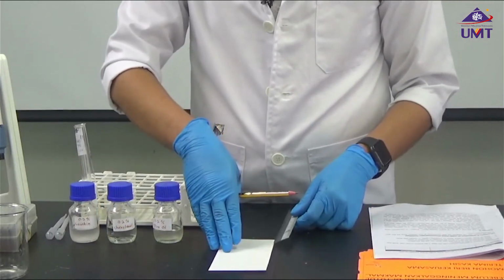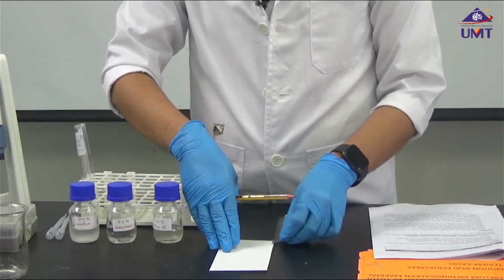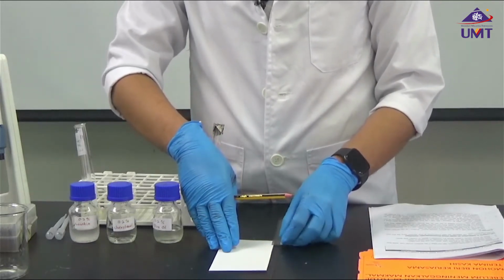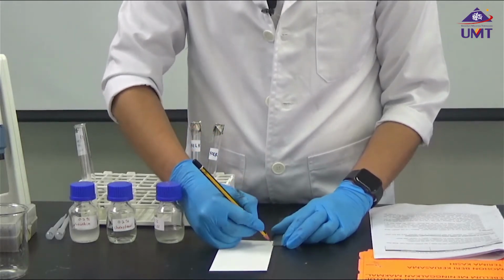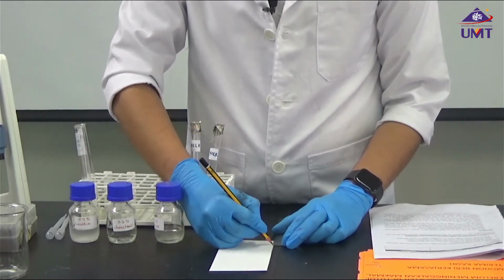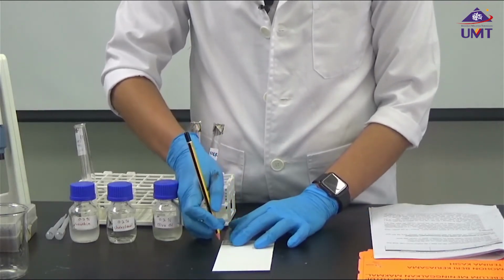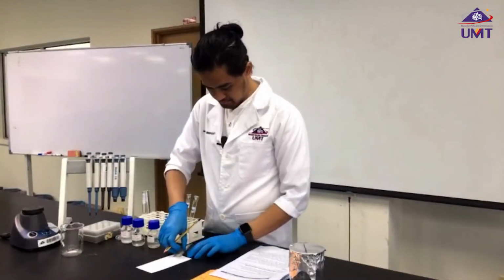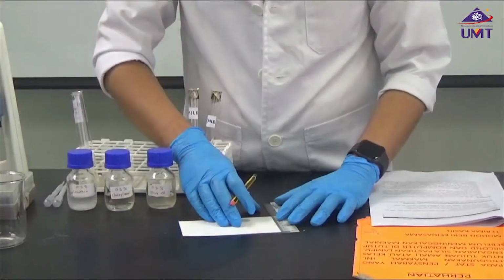Approximately about 1 centimeter from the bottom, in this instance I take 2 centimeters. Draw the line.